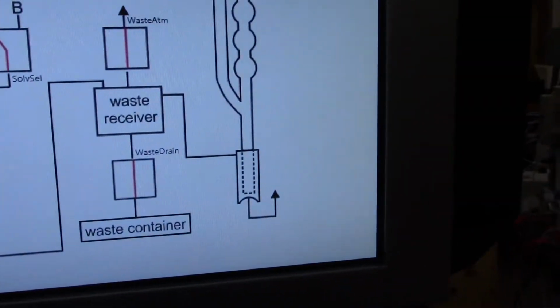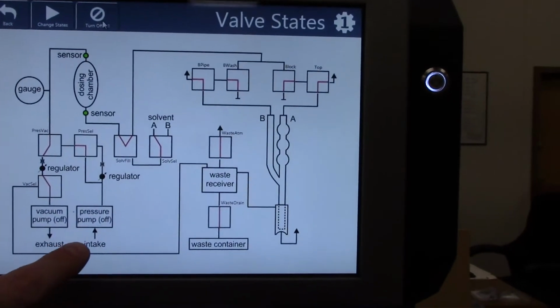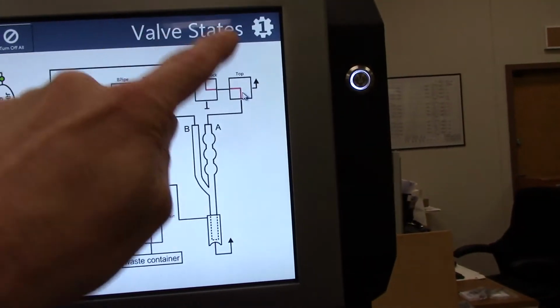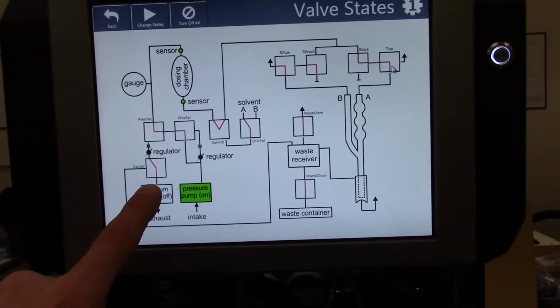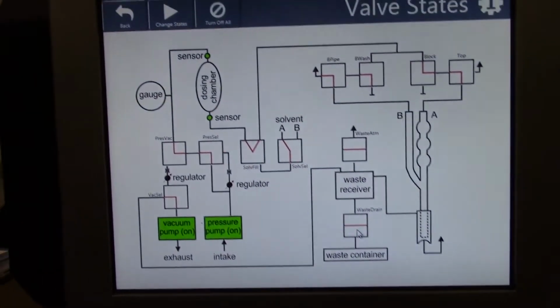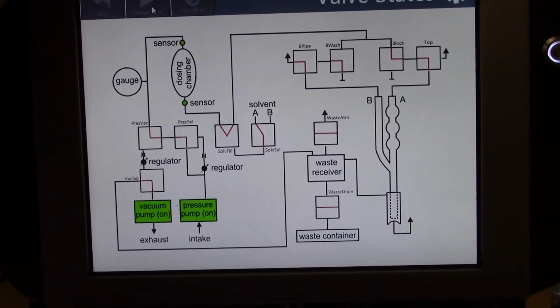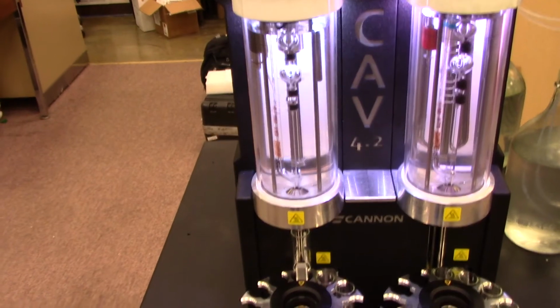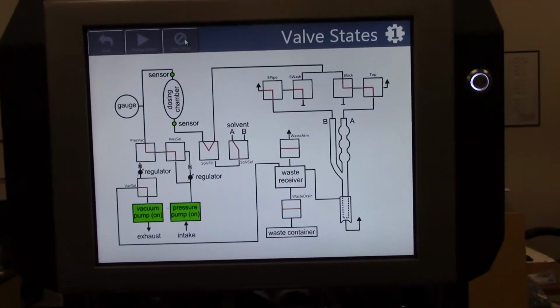Then you need to empty the solvent. Coming back to the valve state screen, we will use the pressure pump to blow the solvent down into the tube through the A pipe. We will use the vacuum pump to draw the solvent out of the cup. That's all there is to it.